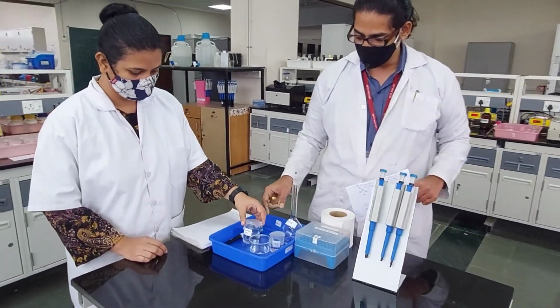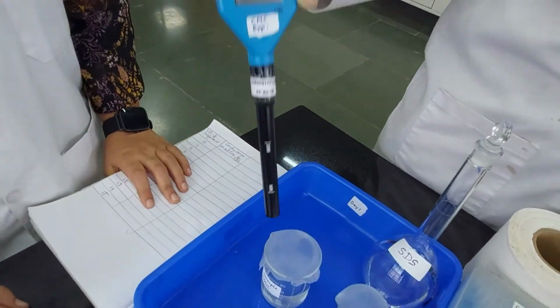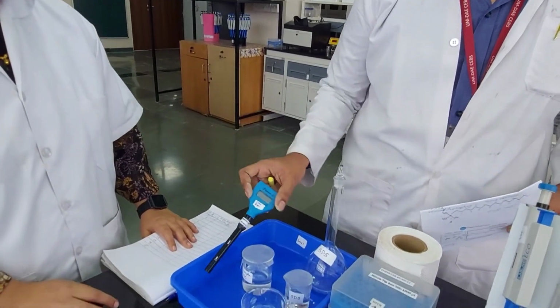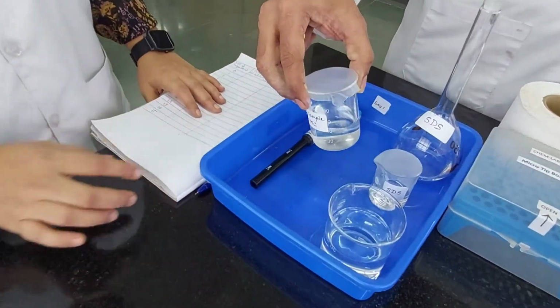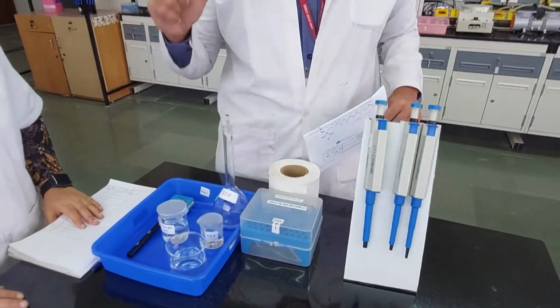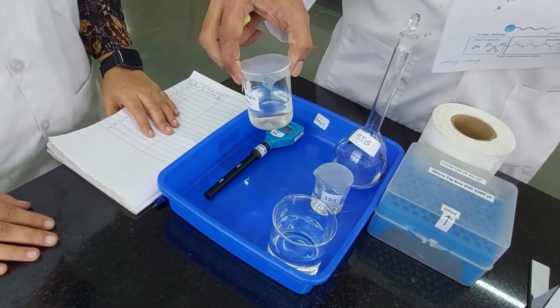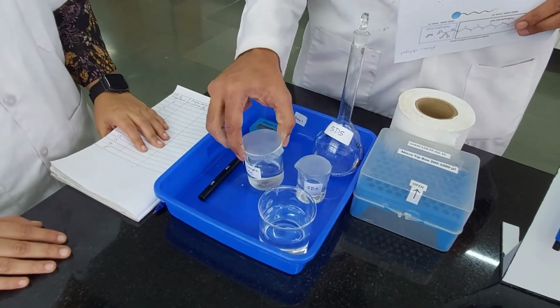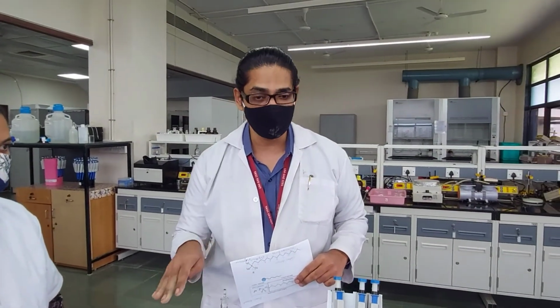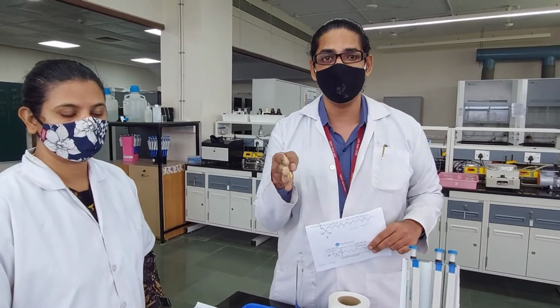So this is our simple setup for today's experiment. We have this conductometer. It's a pocket conductometer which you dip in a solution and the digital display will be seen on the screen. Then we have this distilled water. This is one of the experiments we are going to do for demo purposes, but all the other data has already been done for you. We are going to find the CMC for SDS today, and see the critical micellar concentration by titrating in.